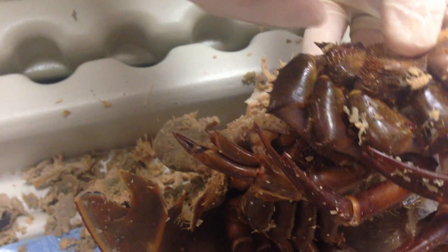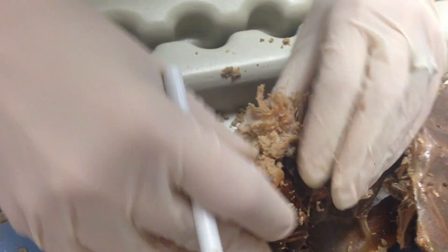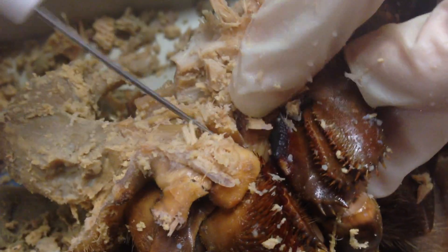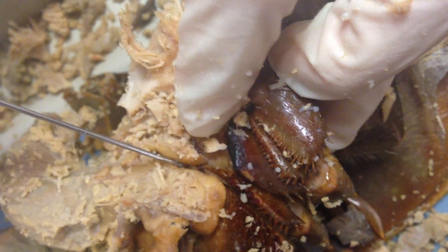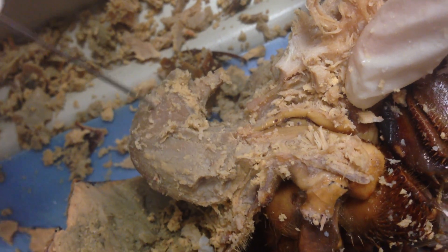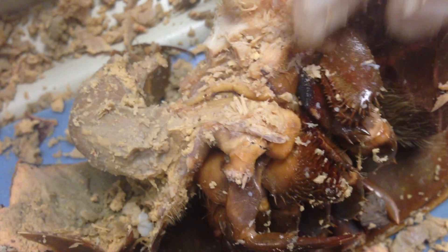Here you can see the female pedipalps on this second specimen. We've taken a lateral incision and this is the gnathobase — you can follow the mouth to the esophagus, and it actually enters into this structure right here, which is the proventriculus, leading to the valve. And those are the things that you need to know in the horseshoe crab.